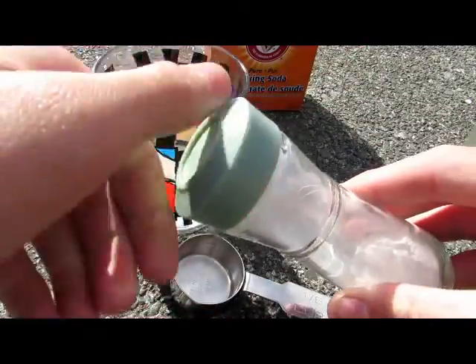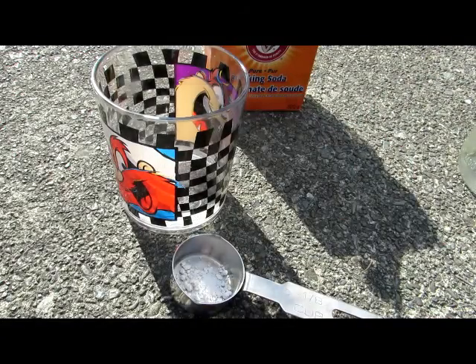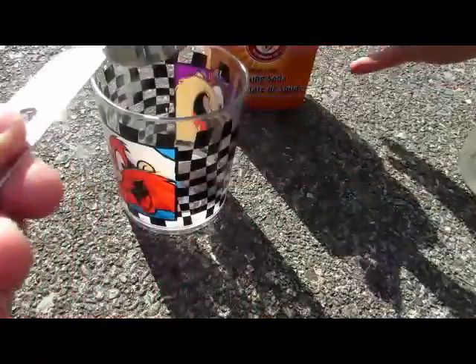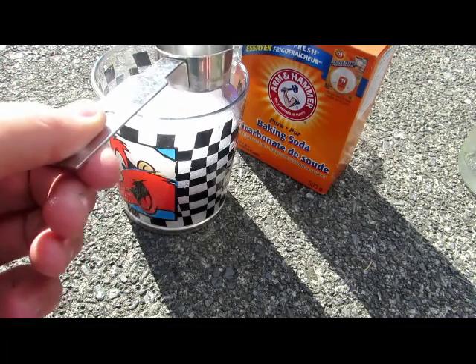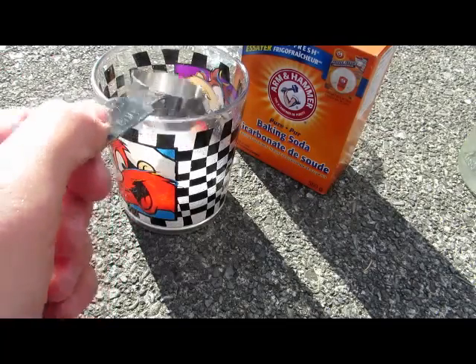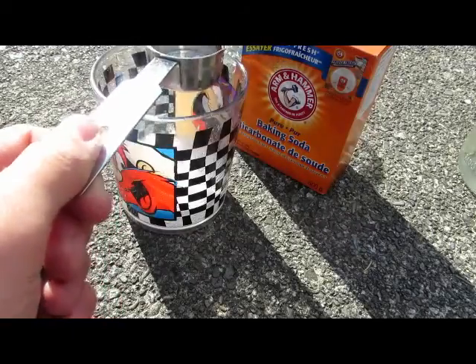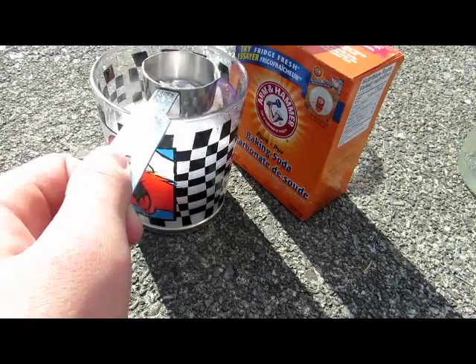To further confirm the product, we're setting up a carbon dioxide generator. We pour some lithium peroxide into a container and seal it up, then generate CO2 by adding baking soda to vinegar, which produces the reaction of acetic acid and sodium bicarbonate forming sodium acetate, carbon dioxide, and water. This CO2 is then hopefully absorbed by our lithium peroxide, forming lithium carbonate and releasing oxygen gas. We add more and let this go for a bit to ensure it absorbs a fair amount.